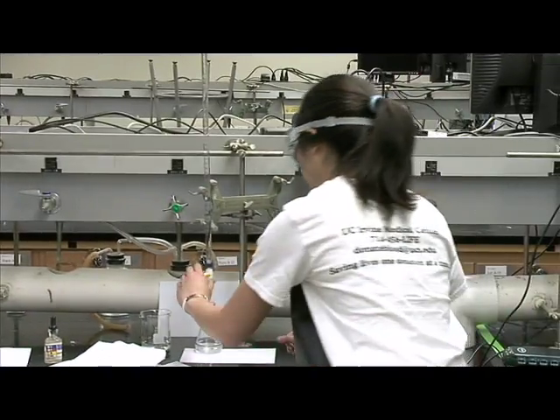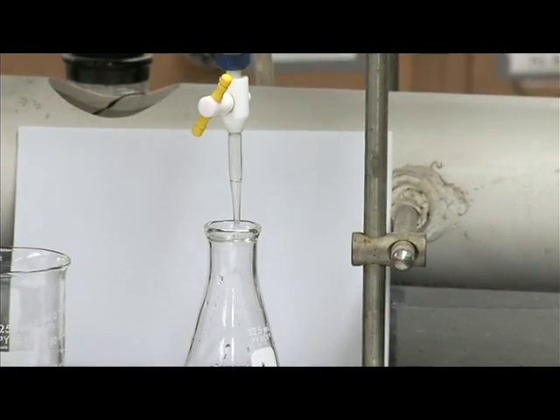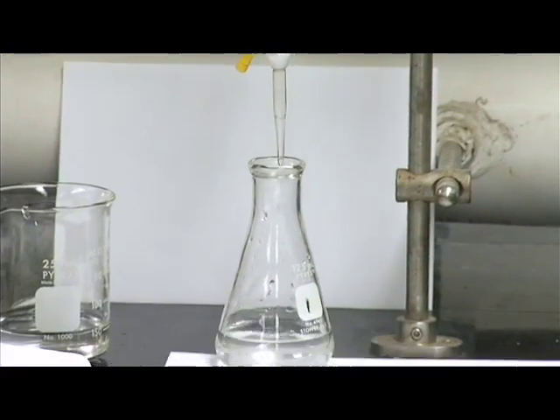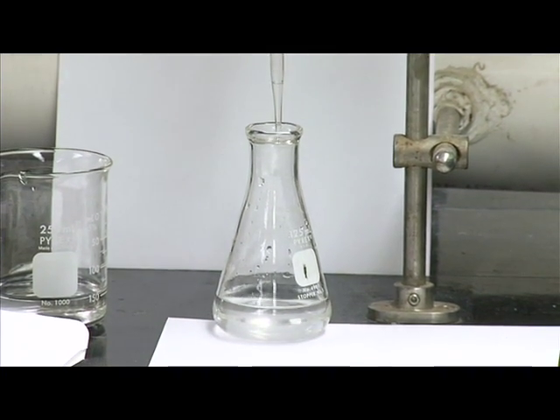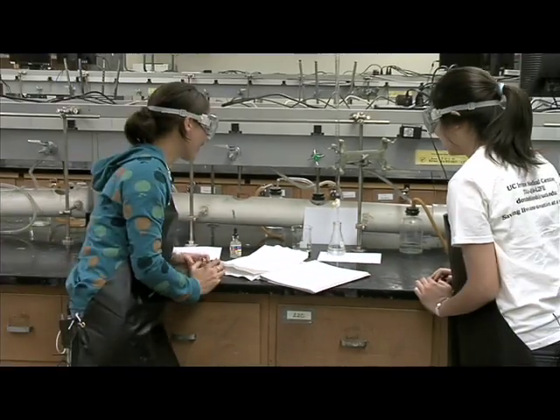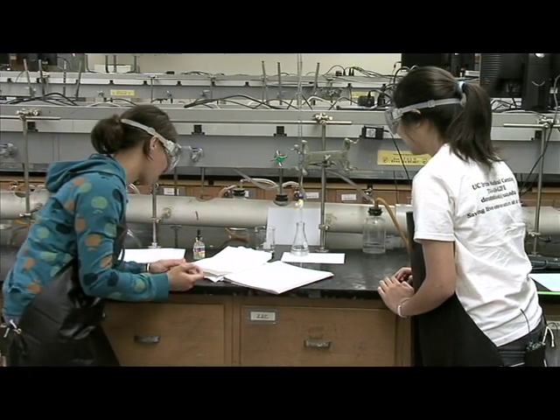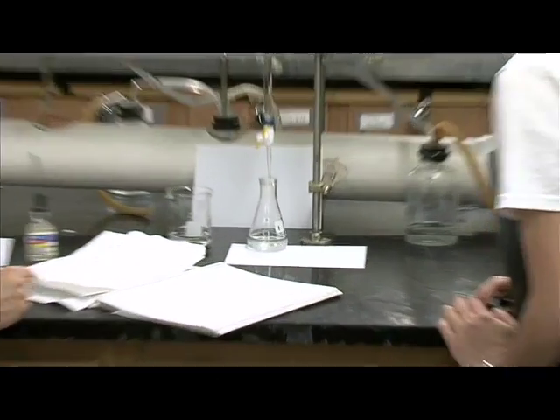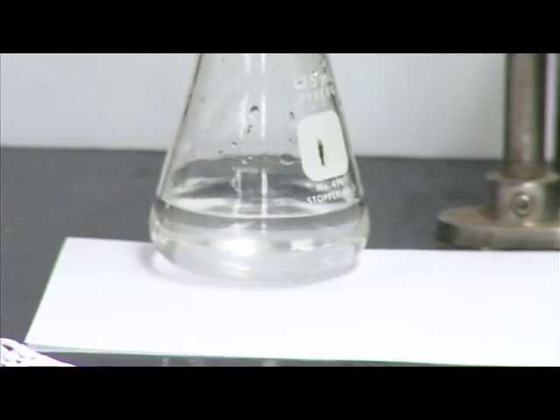Ooh, look! When it hits the reactant, it turns purplish pink really quick. And then poof! It disappears again! It's like magic! I know! And this paper really helps us see the color change. Okay, maybe we should slow down now.